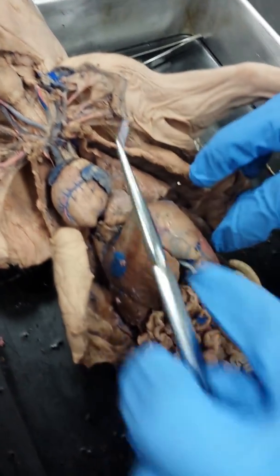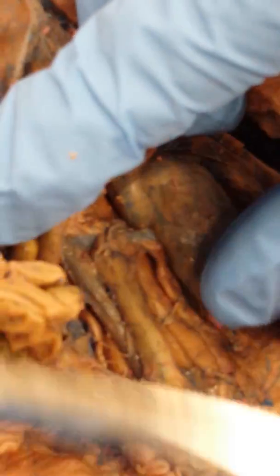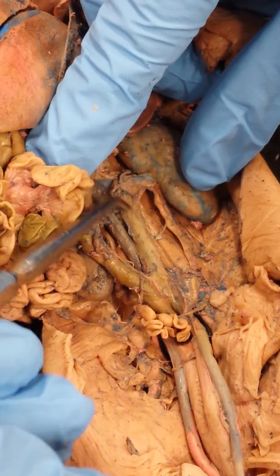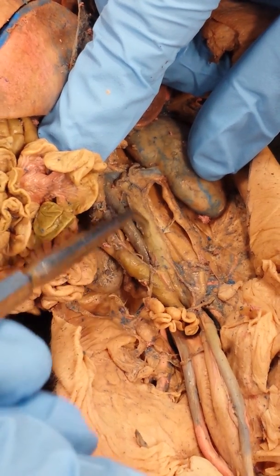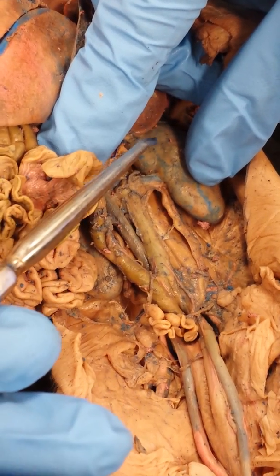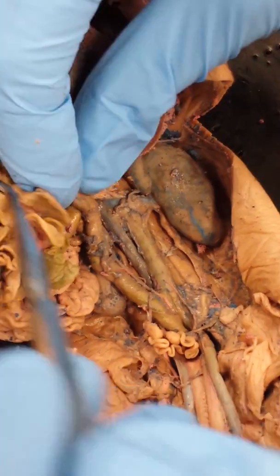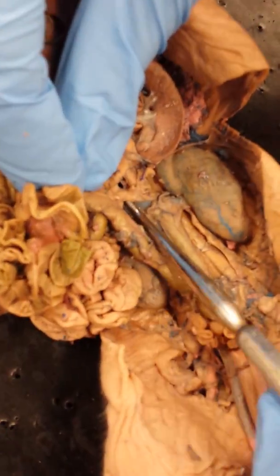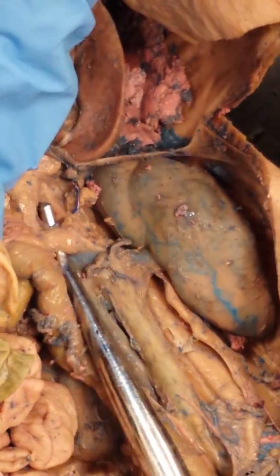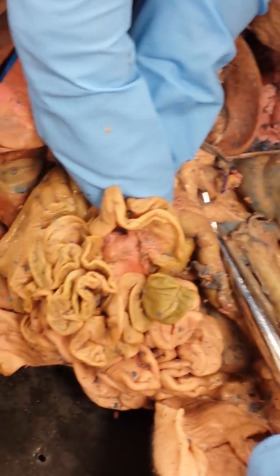Alright, let's look at the bottom part. I'm going to look for the dorsal aorta. It kind of appears greenish, but there's the dorsal aorta right here. Now, in your notes, coming off the dorsal aorta is something called the celiac trunk. All you want to know is name an artery coming off of that and the organ it's sending some blood to. Now, an artery that I could point out in the pig is something called the anterior mesenteric artery. It's really thick, and it even says thick in your notes. And that will be taking blood to the small intestines and large intestines.